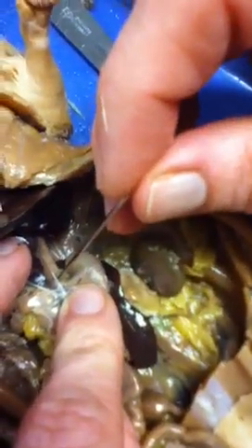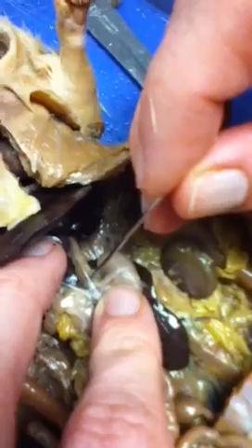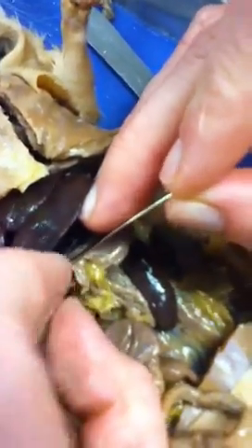This point of meeting is your cardiac sphincter. And then this is your pyloric sphincter that leads into the small intestine. So you have three parts of your small intestines, which are the... I don't know. This one starts with a J, and then the one starts with I. And then ileum. Yeah. And then this leads into your cecum here, and then that goes into your large intestines, which is your rectum and your colon and all of that.